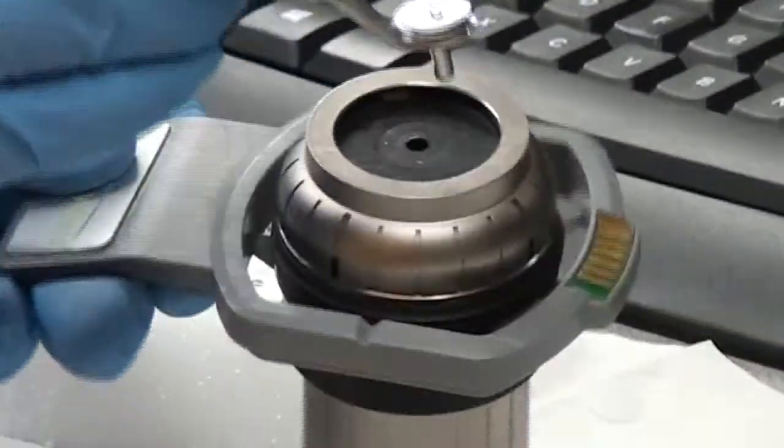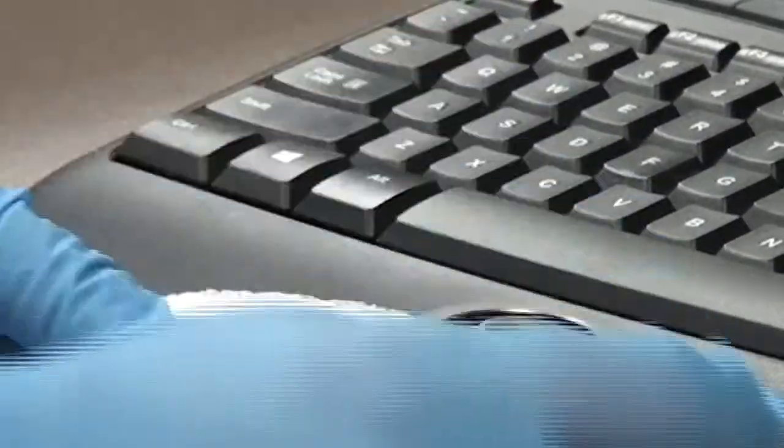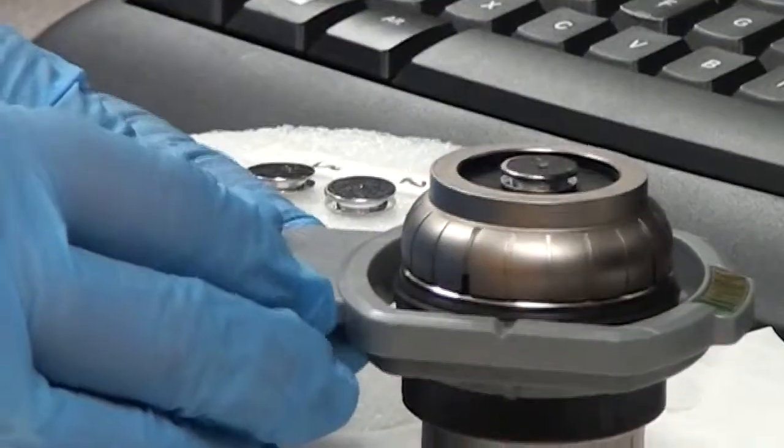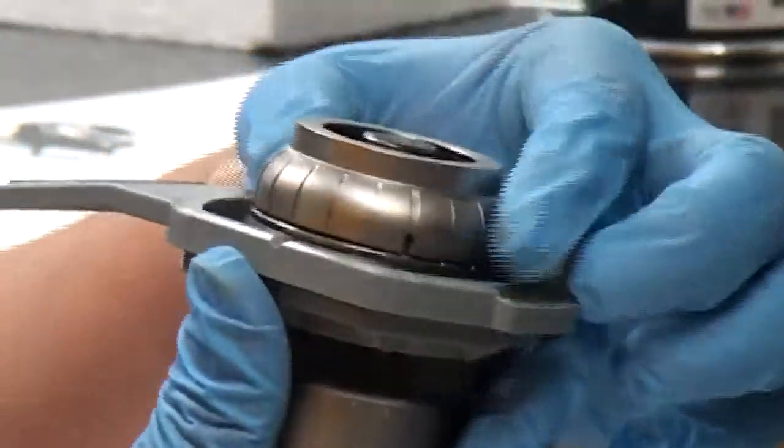We have to make sure that the top of the mounted sample must sit below the lip of the sample holder to avoid damaging the machine and the sample. And we do that by adjusting the height, rotating the rim.